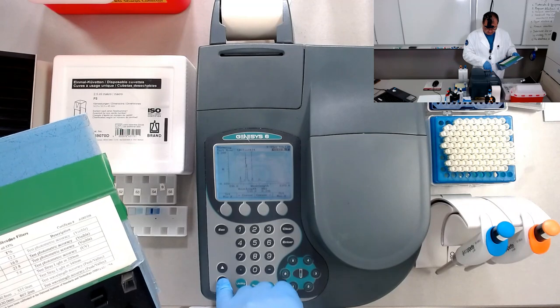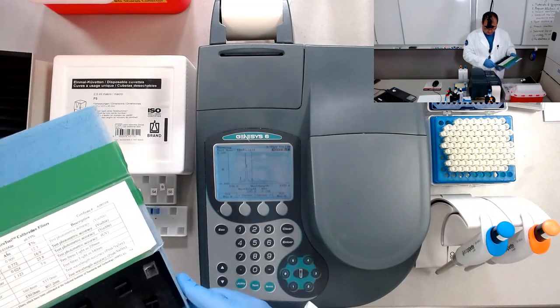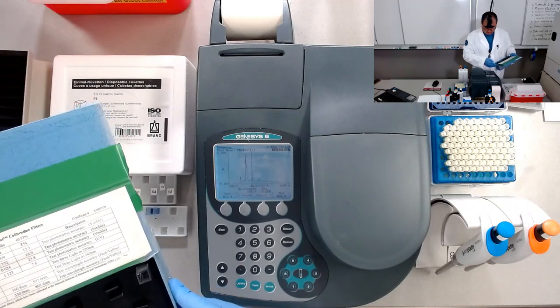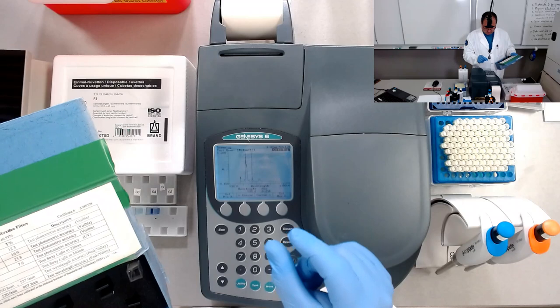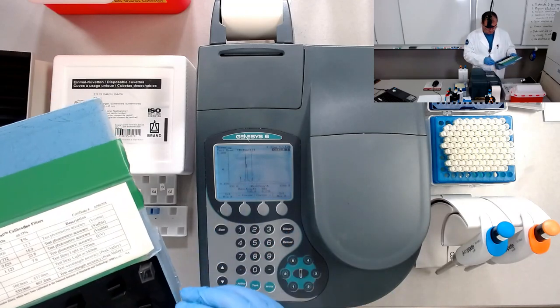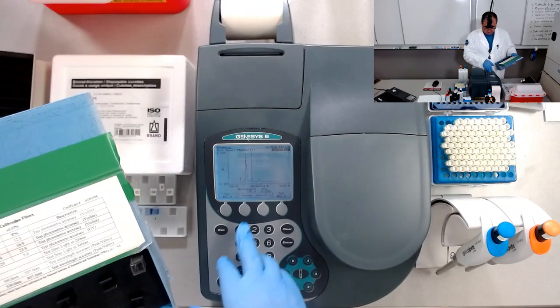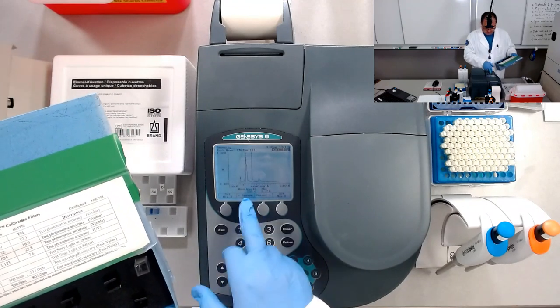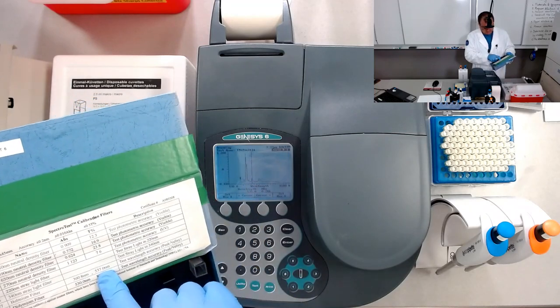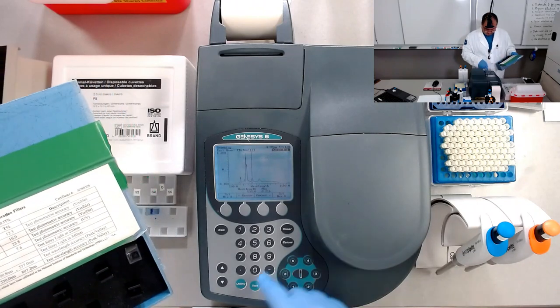Unfortunately, my 5 nanometer step is pretty large. But anyway, if I had only a 1, 2, or 3 nanometer step, it would have been better for me to get the peak. But the peak is at 535. It's a little bit more than 535, and here goes with 537. And I think that the instrument is well calibrated, very good.